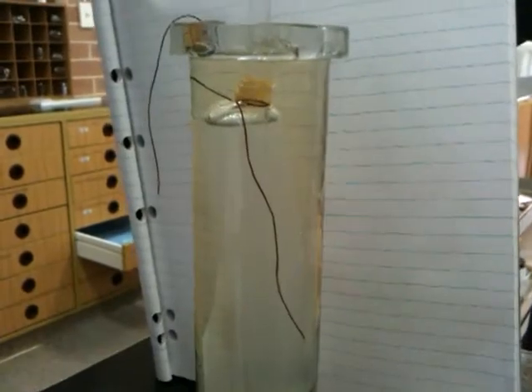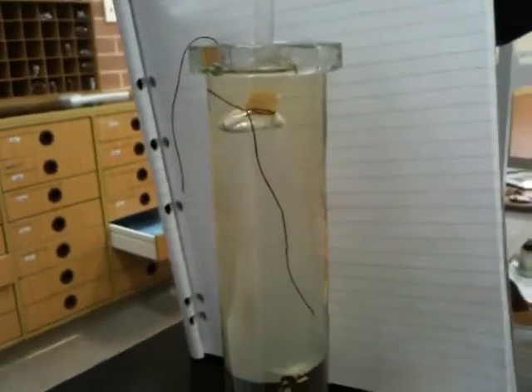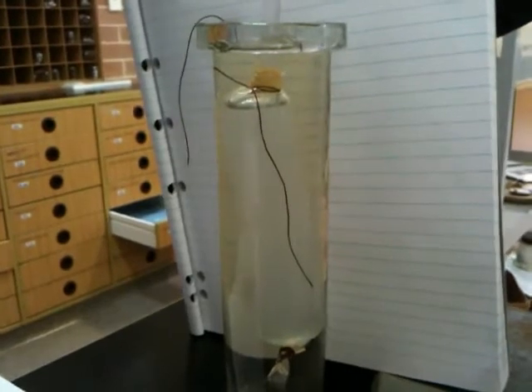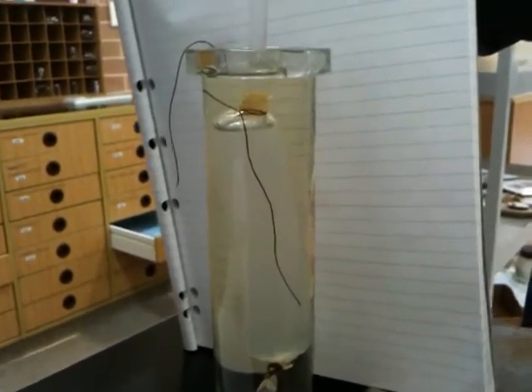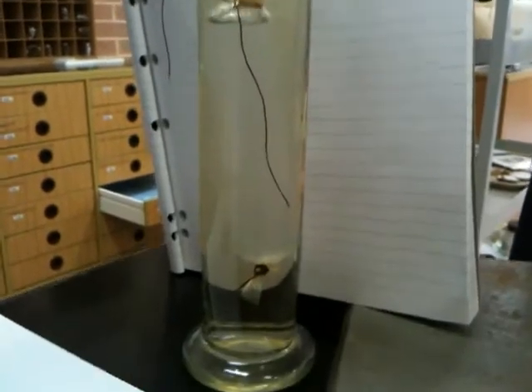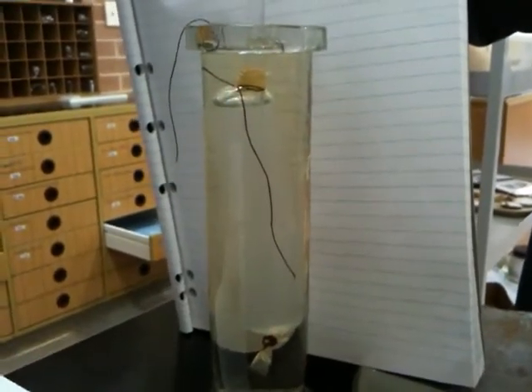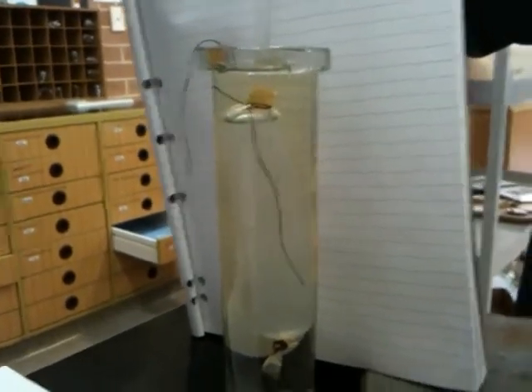A blue-black colour appears. So tell me, what's in the gas jar that we're looking at right now? Water and potassium iodide. Great. And what does that chemical do? What are we trying to indicate? That the iodine will enter through the semi-permeable bag, and when it comes in contact with the starch, it will change colour. Good, so it'll change to blue-black.